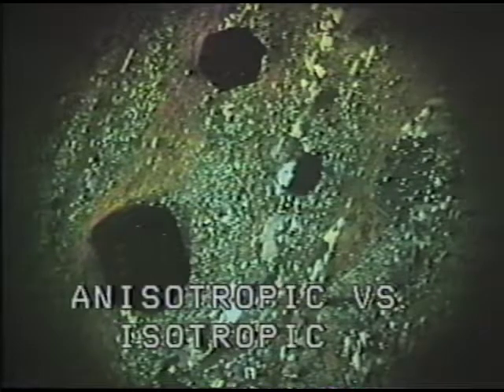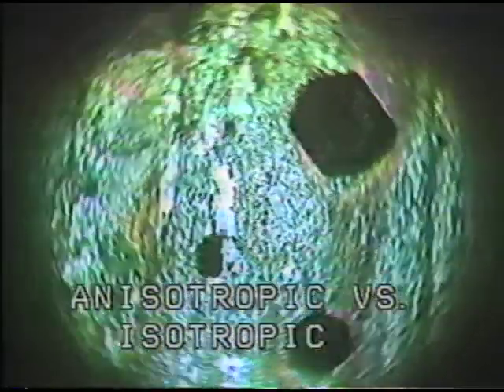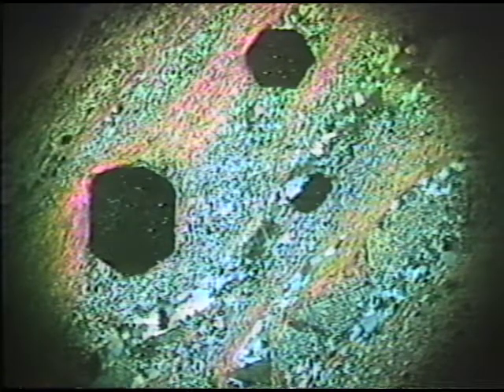Now, if we want to distinguish anisotropic from isotropic minerals, we should again cross the polars, as I've done now, and we look at the distinct mineral grains during rotation to see which ones are illuminated during most parts of the rotation. You can see most of the minerals, including the ones that I'm pointing at, are illuminated during most of the rotation periods, but we do have these large equidimensional masses that remain dark. These are the garnets within the rock, and this demonstrates the method of distinguishing isotropic from anisotropic using the petrographic microscope.